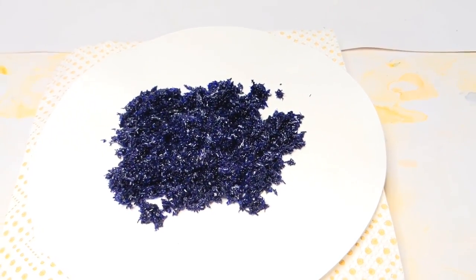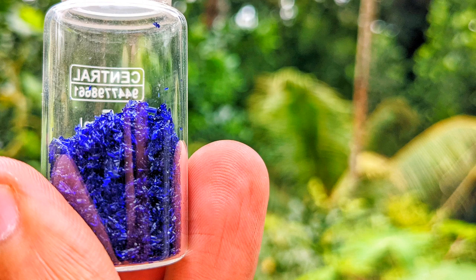Finally, I put some amount of the crystals into a small glass bottle to take a picture of it and this is what it turned out to be. And I was successful in my third attempt of making the crystals of tetramine copper 2 sulfate.